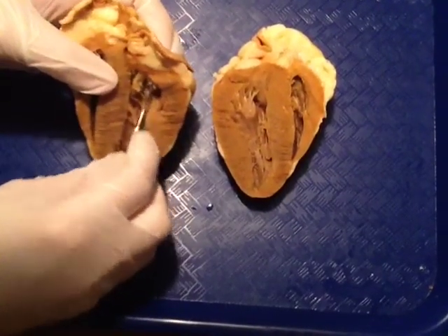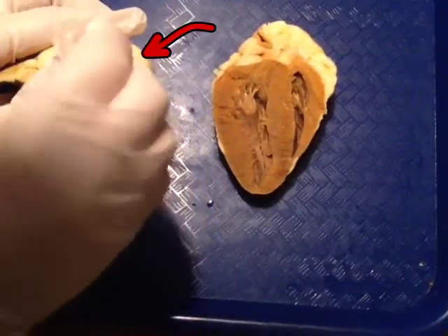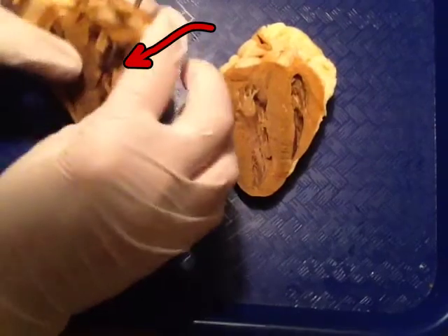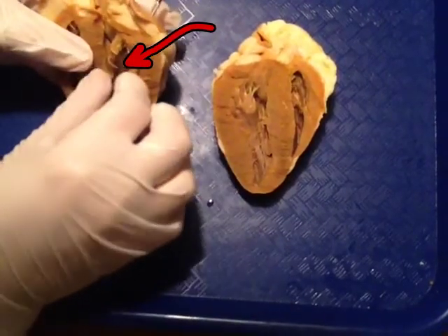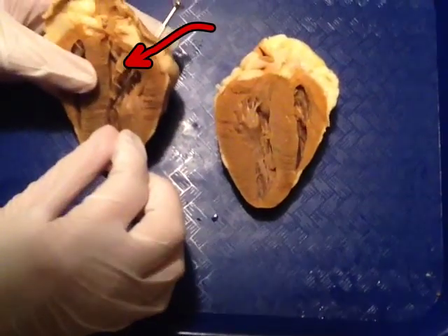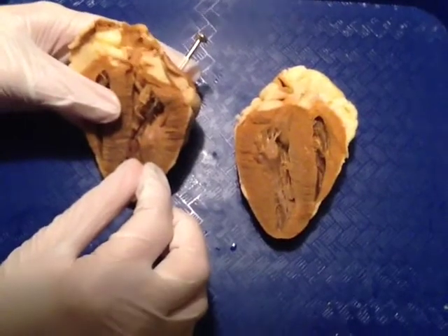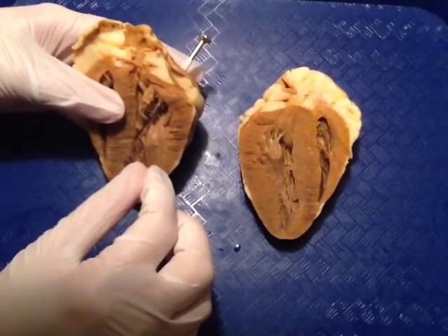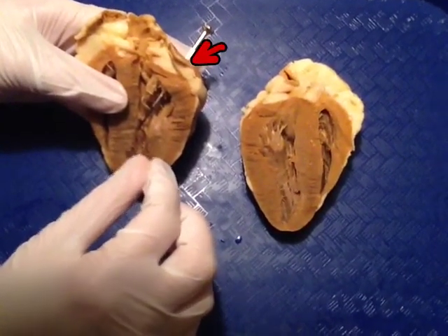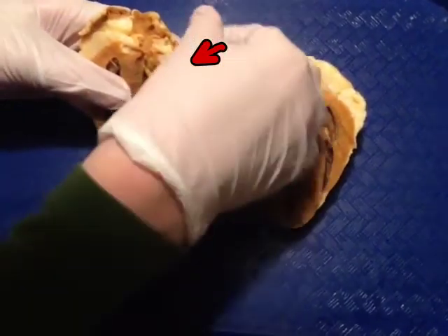The left atrium leads outside right here. The left atrium is associated with the second blood vessel we are going to talk about: the pulmonary veins. The pulmonary veins is the blood vessel that goes through the left atrium.